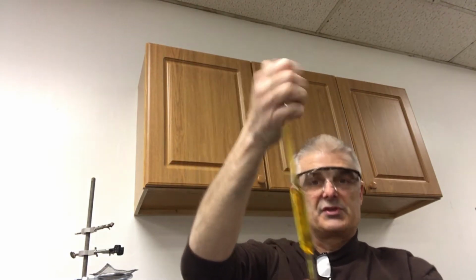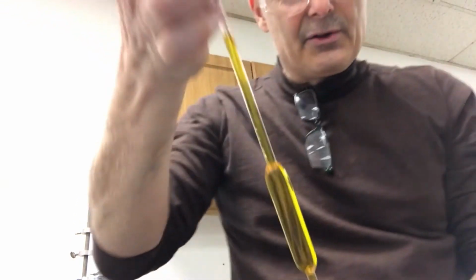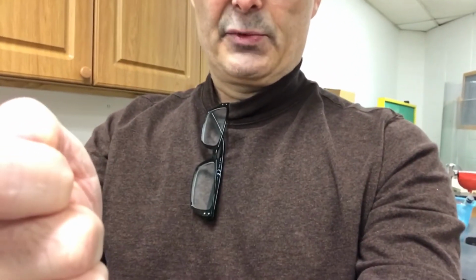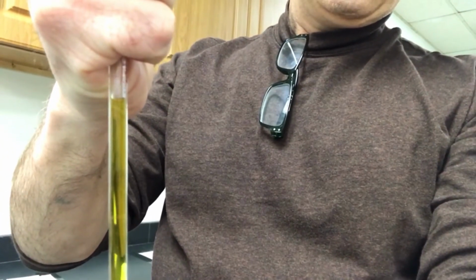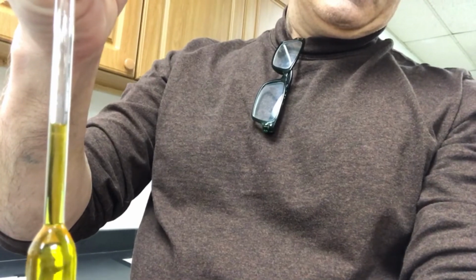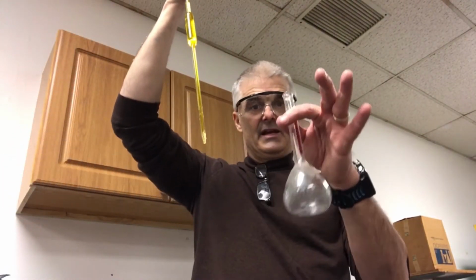And now this is a pretty precise thing. I don't know if you can see this. I'm going to allow the liquid to drop. I'm just going to relieve pressure. Bring the camera up here. I'm going to take my thumb and relieve a little pressure. And when I relieve a little pressure, watch what happens. The liquid goes down, and I'm going to do this right till I get to the line. I want the bottom of the meniscus right on the line, which is exactly what I have. And so now I have exactly 15 milliliters.